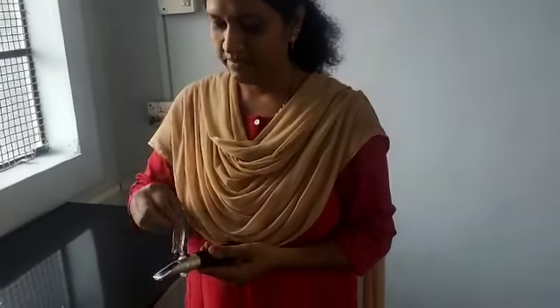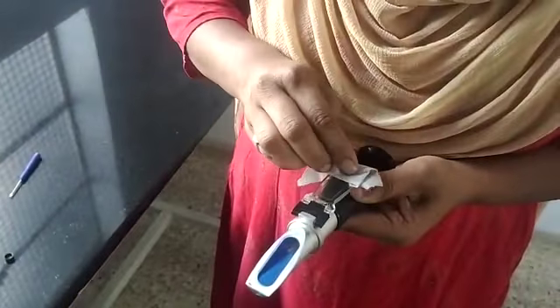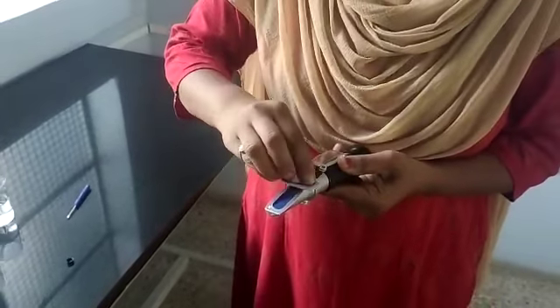After calibration, clean the daylight plate and cover plate also — ensure there is no air bubble and no water drop remaining.